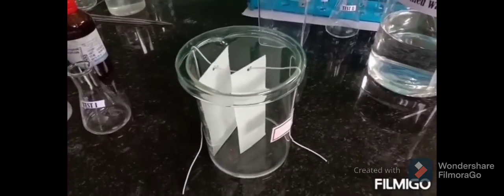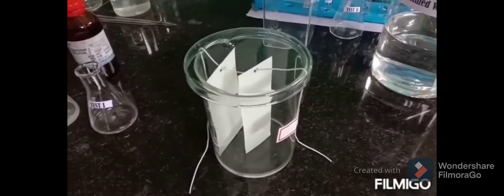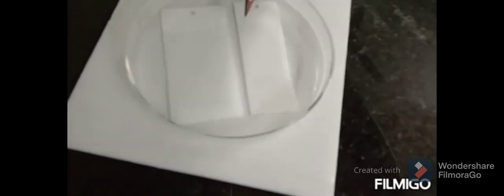After approximately two hours, or when the solvent front reaches two centimeters from the top, the paper is removed. The solvent front is carefully marked with a pencil.